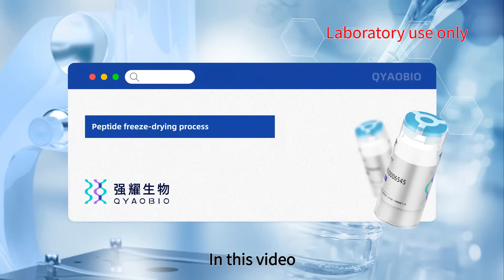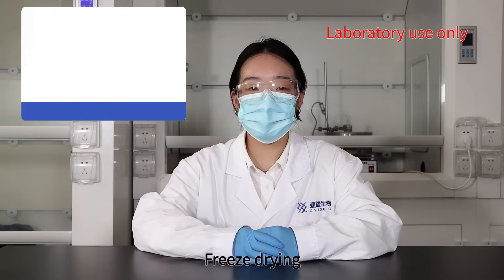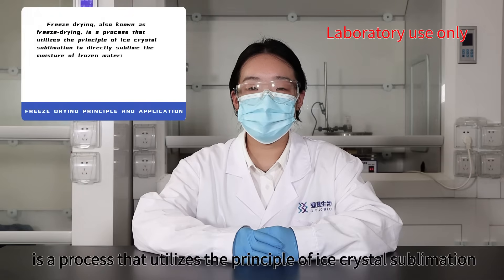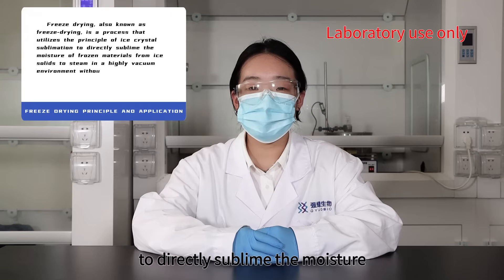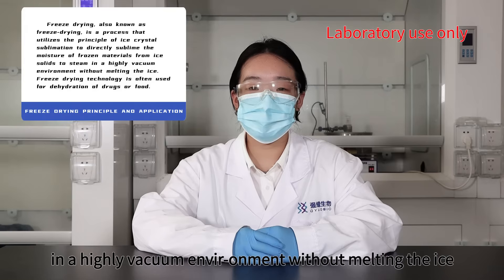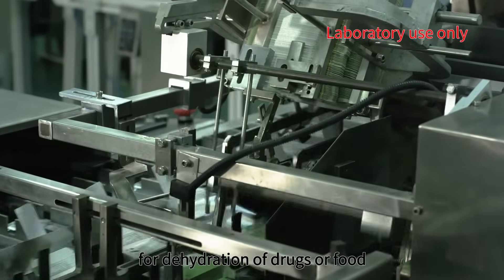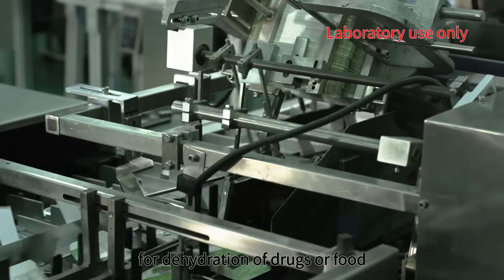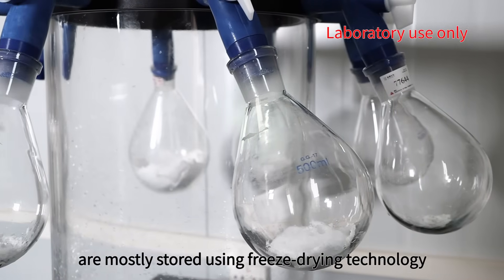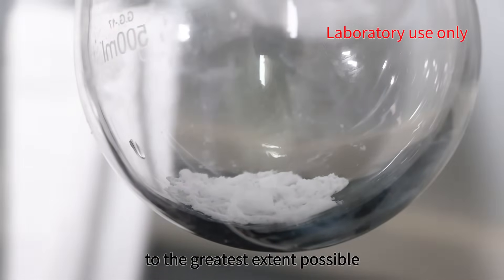In this video, we will talk about the peptide freeze-drying process of Qiangyao Biotechnology. Freeze-drying is a process that utilizes the principle of ice crystal sublimation to directly sublime the moisture of frozen materials from ice solids to steam in a highly vacuum environment without melting the ice. Freeze-drying technology is often used for dehydration of drugs or food. The peptide products of Qiangyao Biotechnology are mostly stored using freeze-drying technology to ensure the stability and activity of the peptides to the greatest extent possible.